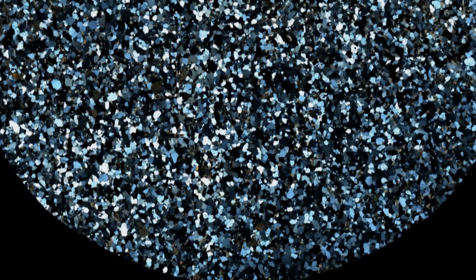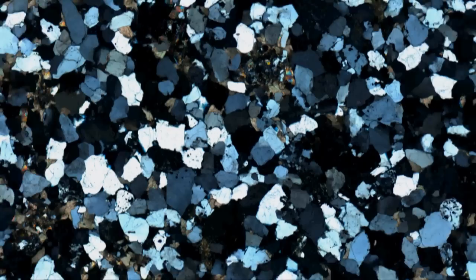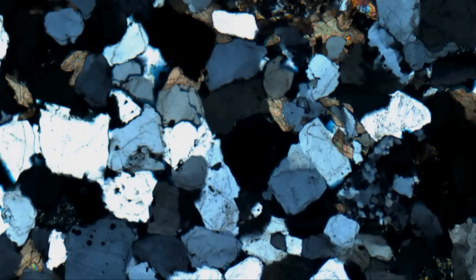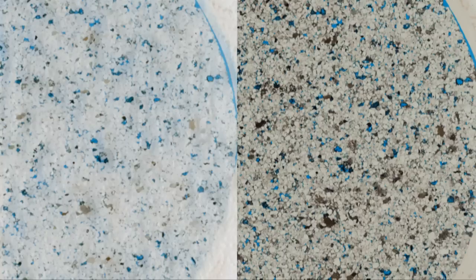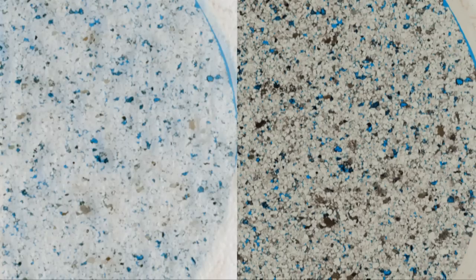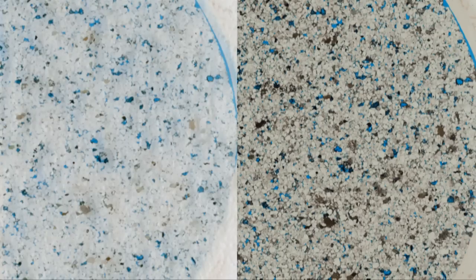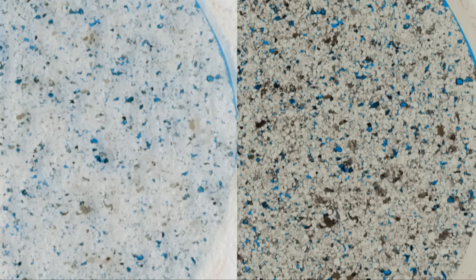A key advantage of this process is the zoomable nature of the resulting image, illustrated here in a cross-polar example. Traditional thin section scanning techniques are unable to capture high resolution, and the resulting images therefore aren't zoomable.